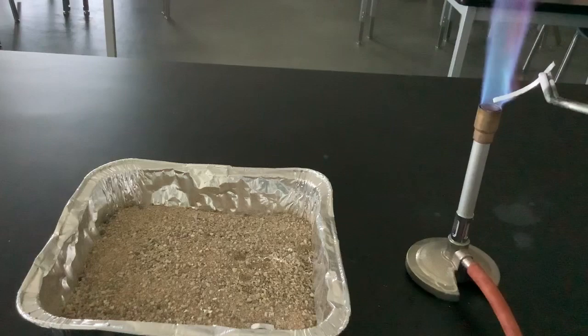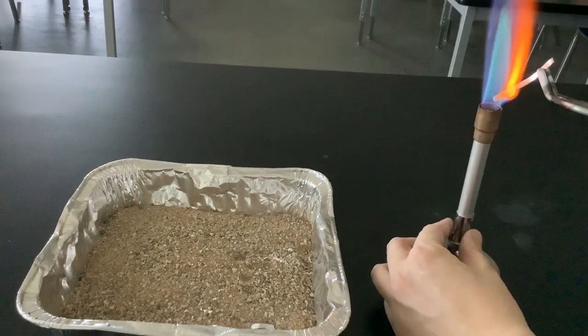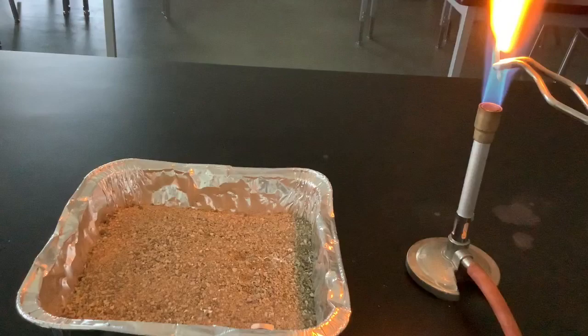Here I am showing you the same reaction from a different angle. I had to adjust the air intake to the Bunsen burner to raise the temperature of the flame. In this reaction, magnesium is reacting with the oxygen in the air, but that doesn't happen spontaneously.